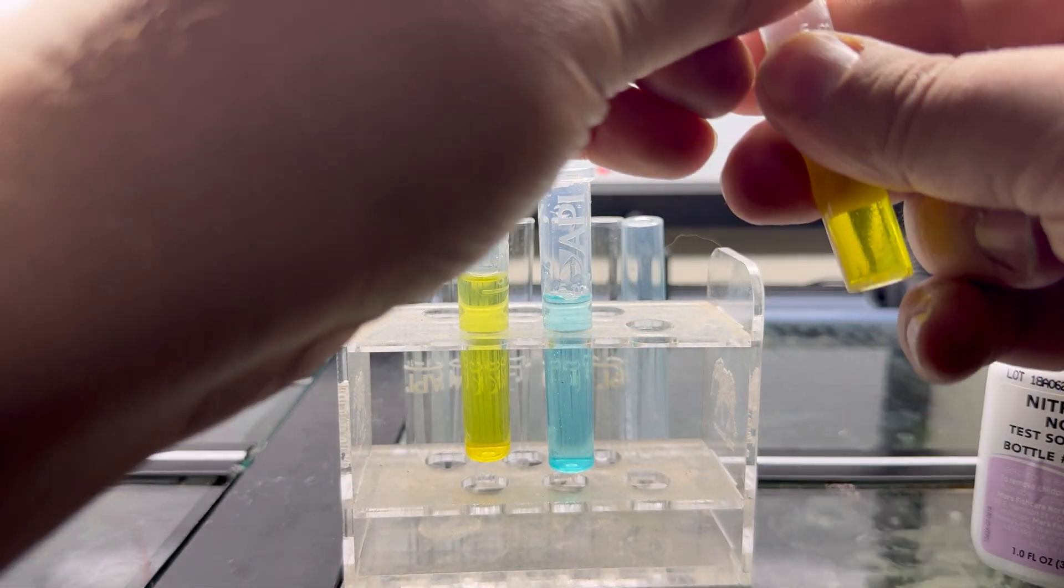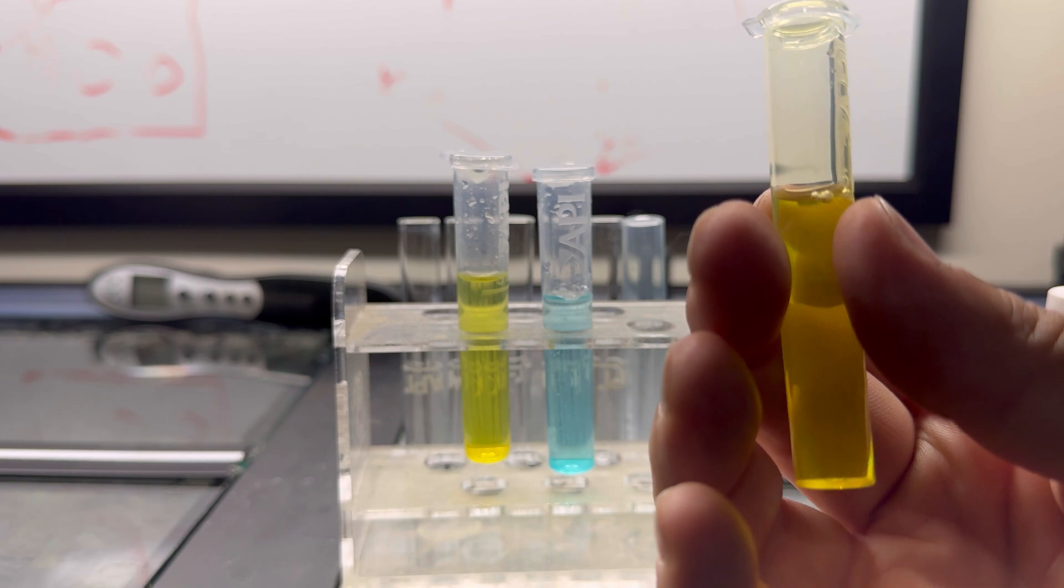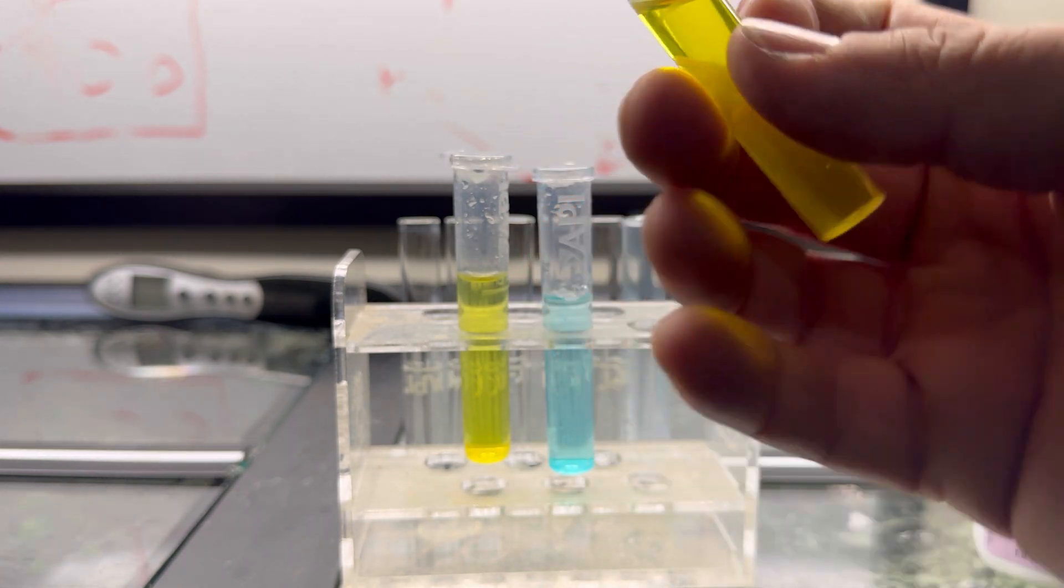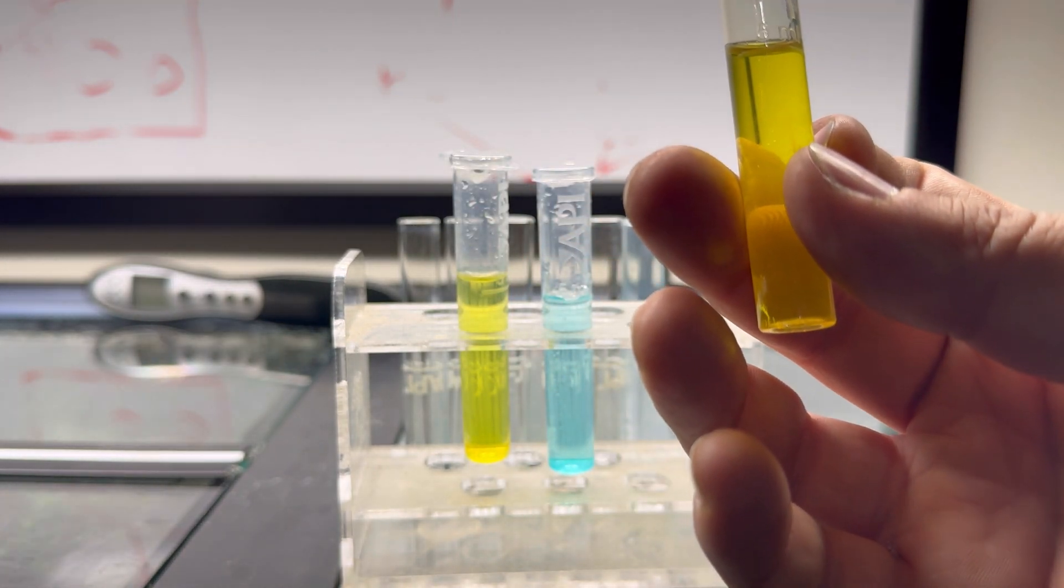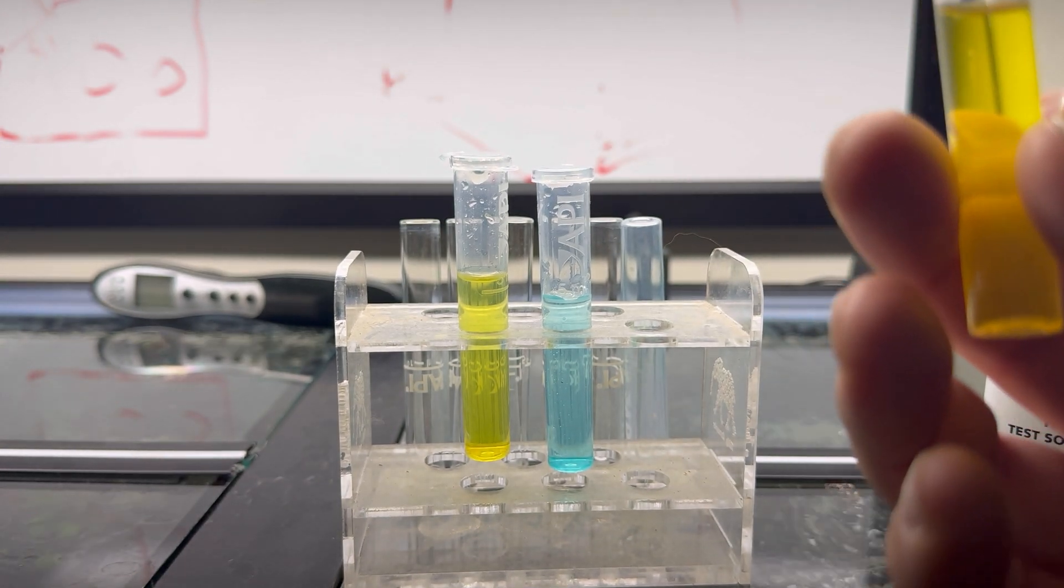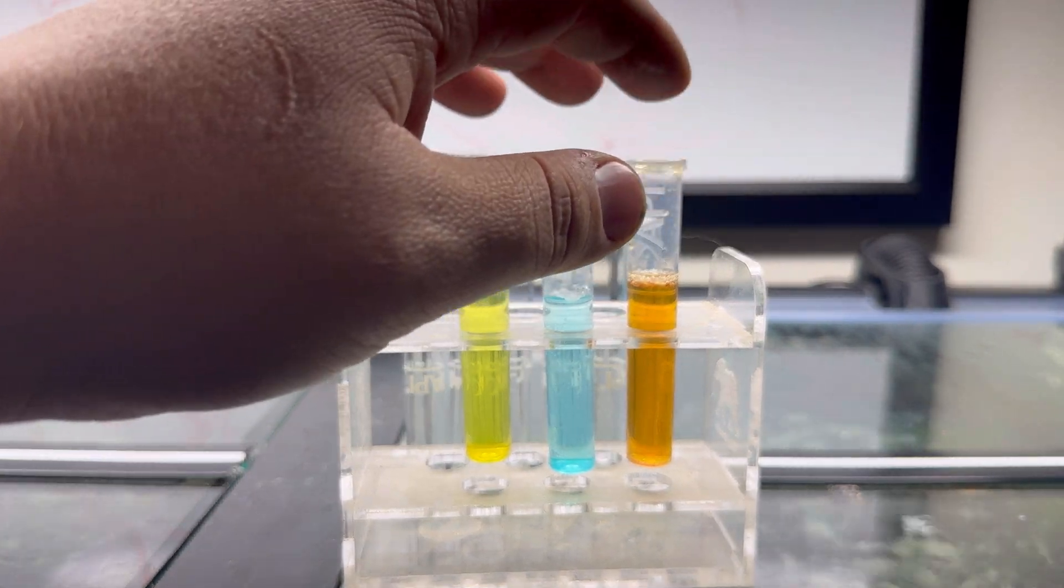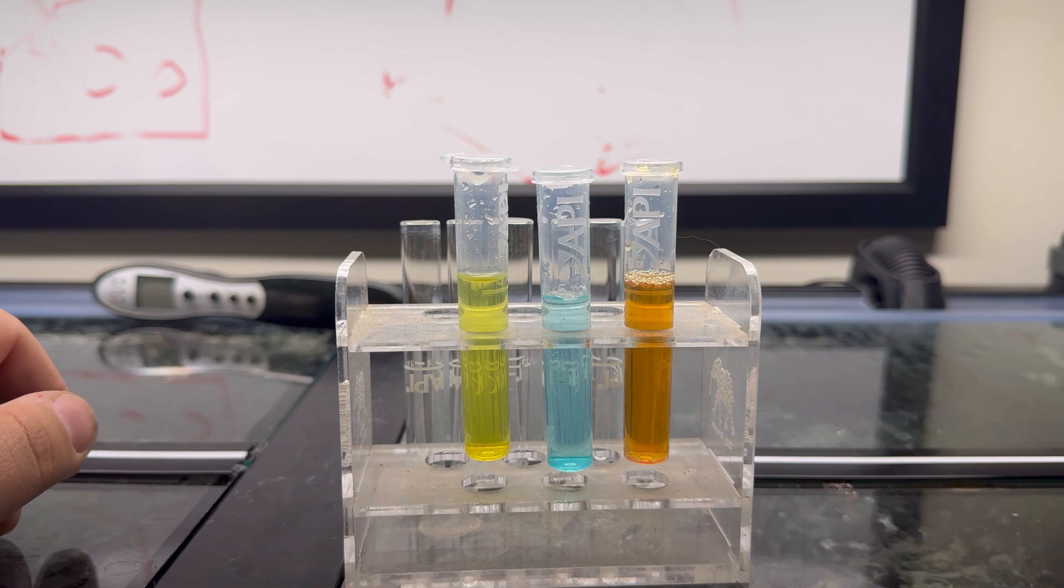One, two, three, four, five, six, seven, eight, nine, ten. Of course, remembering to keep the bottle completely vertical to the vial. Simply put, we're going to invert this for one minute. I like to go one, two, three, four, five, and so on for 60 seconds. Now after we have shaken the last test for one minute.